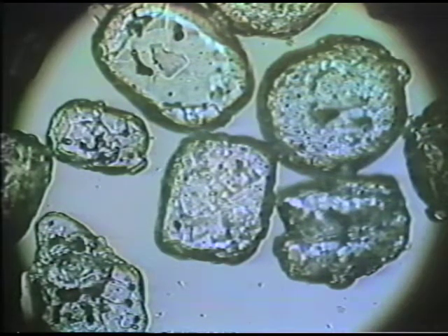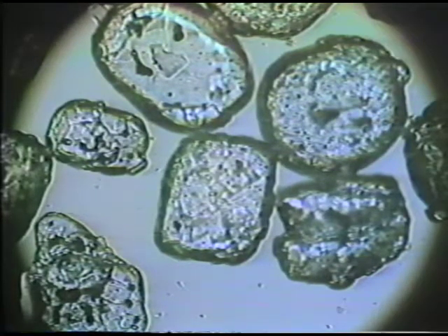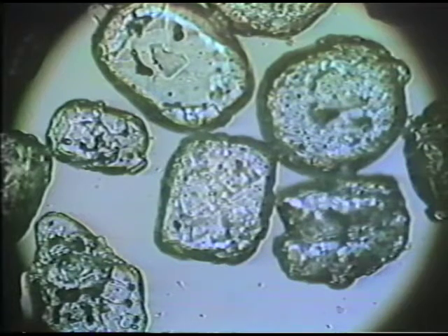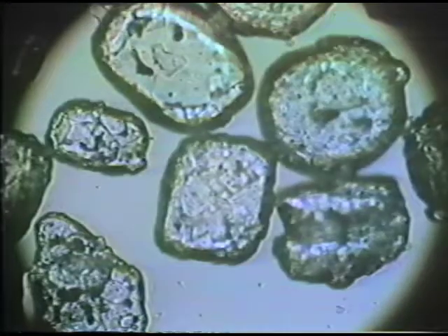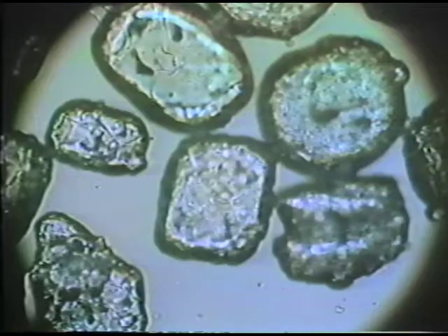One special thing seems to help, and that is that if you can adjust the diaphragm in the lower part of the stage to make the light a bit more divergent, the central illumination test works better. And so I've done this, and now we're taking a look at the mineral grain, and as I look at the mineral grain, I'm going to adjust the focus. And the sense of adjusting the focus is very important.